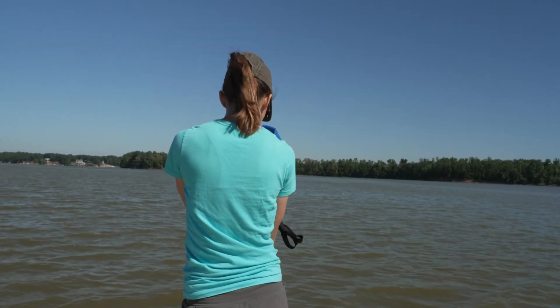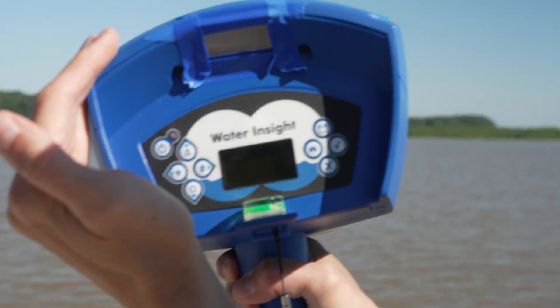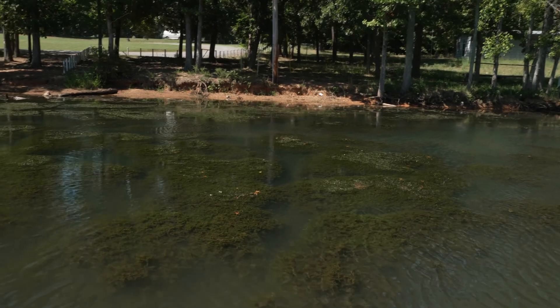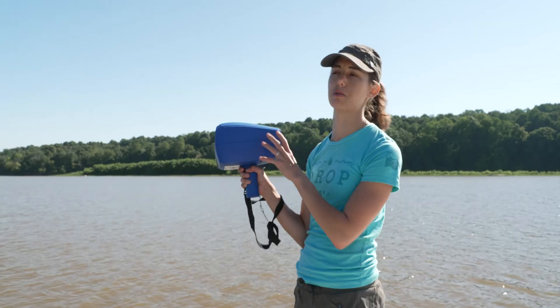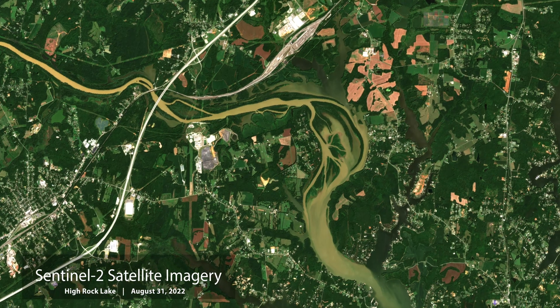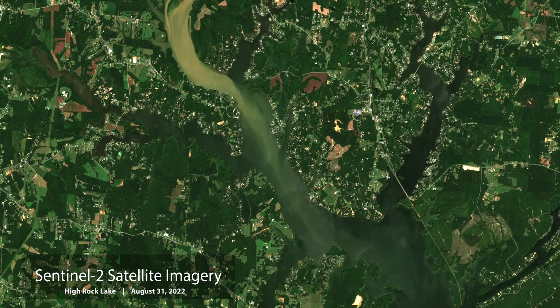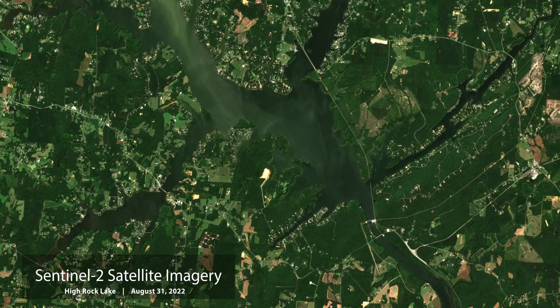I'm going to save this. It actually estimates the chlorophyll for you, as well as suspended sediment and phycocyanin, which is something we're looking for with toxic algal blooms. The idea behind our project is we're trying to collect data concurrently with the satellite overpasses, so this device is really important because the reflectance we get shows the amount of radiation coming out of the water.